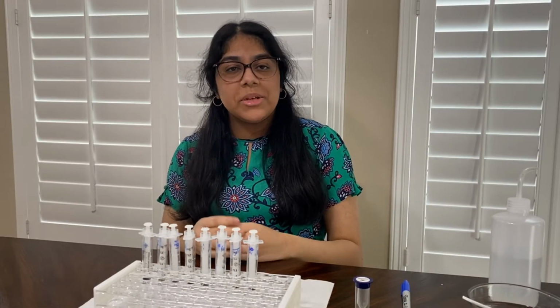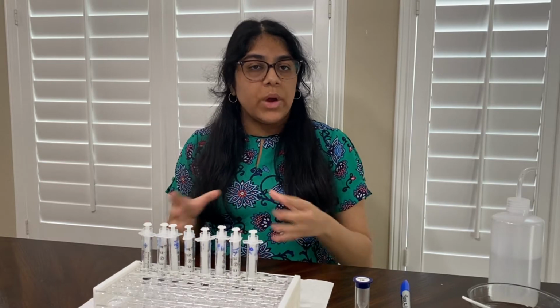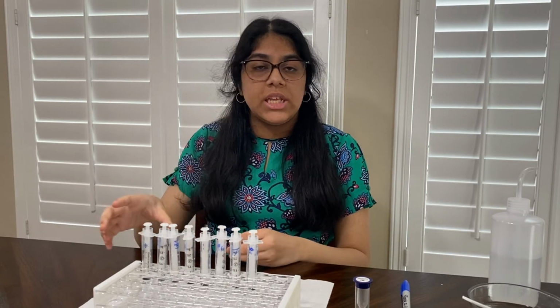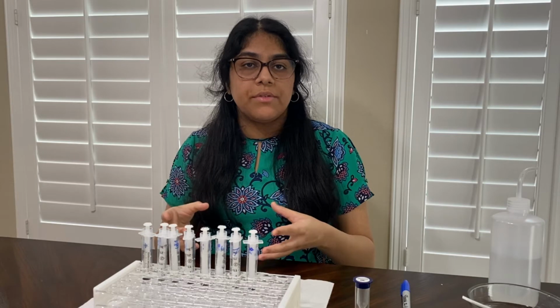Okay, so now I'm going to be demonstrating another method called the binary method, and this is way different from the Dorfman method in that the methodology that I'll be using in order to sort these 8 individual groups into their respective pools is a little bit different.